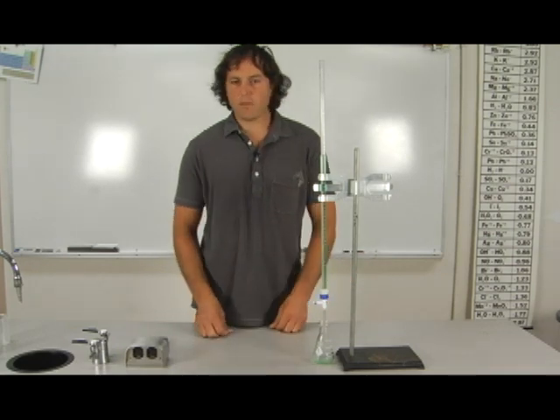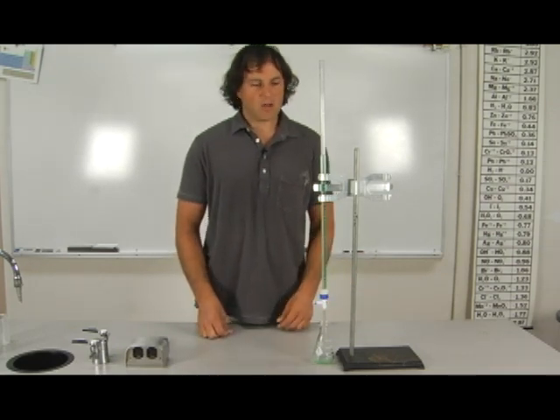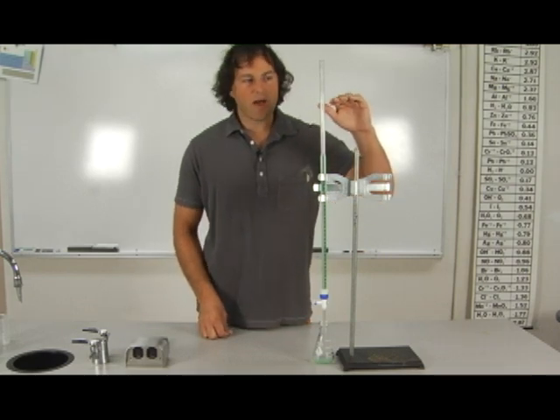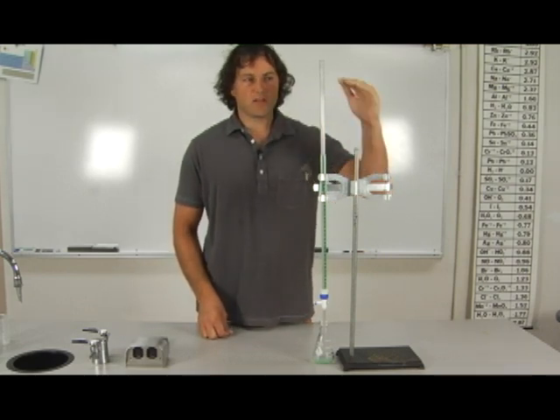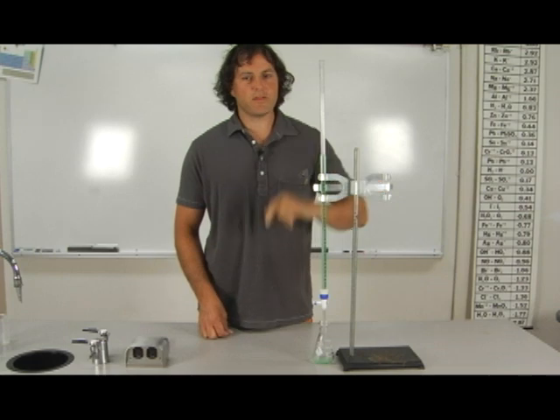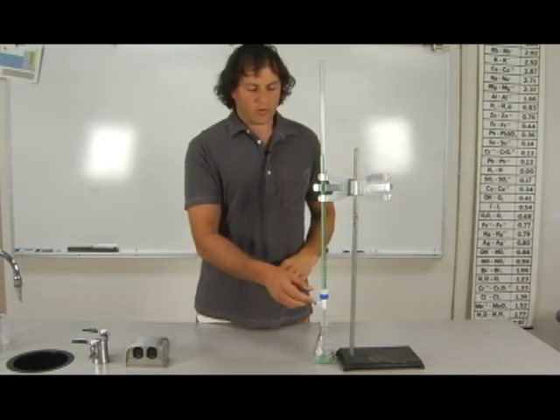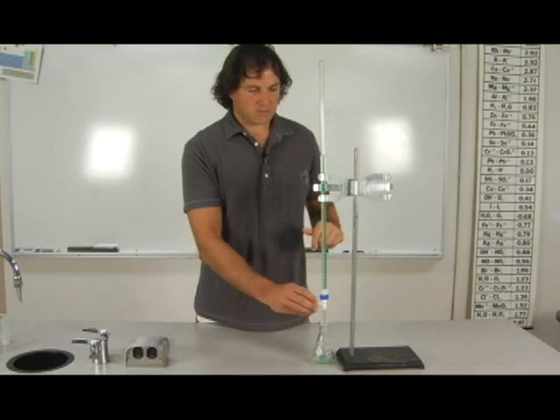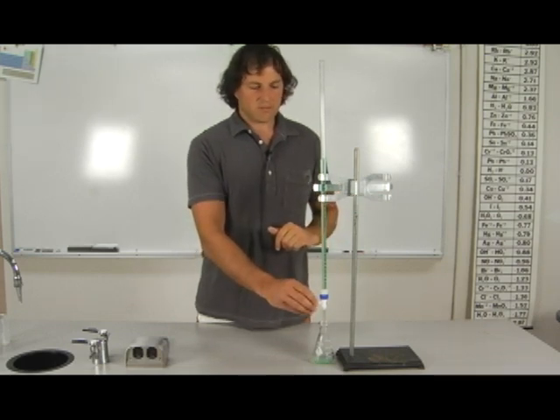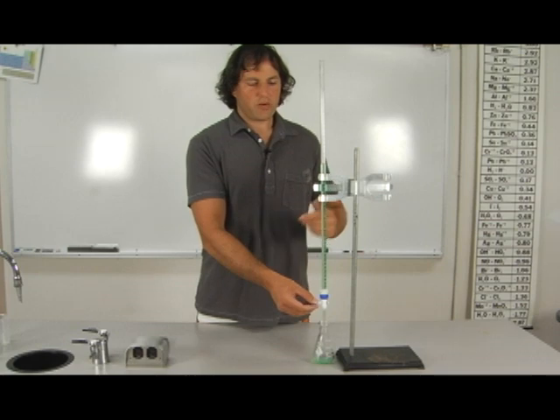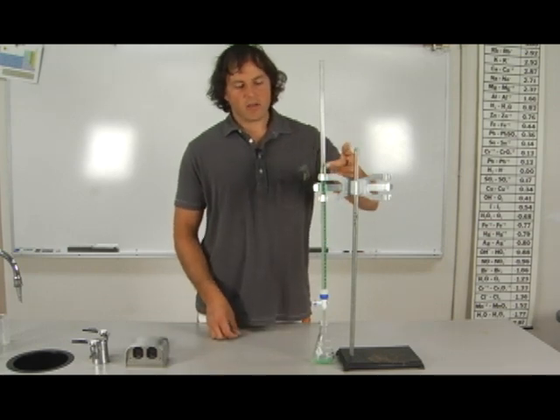When measuring the amount of fluid left in the burette, we fill it up to an indiscriminate amount and write down that number. The burette does not need to be filled all the way up to the zero mark. If we're going to move from this level down to here, we measure our initial amount and get our final amount, and subtract the two to find our actual volume.